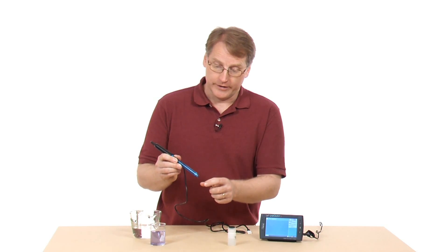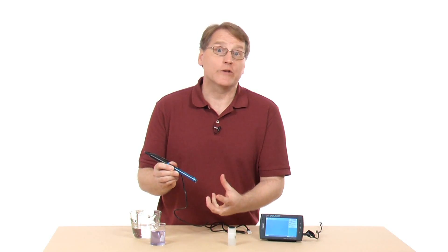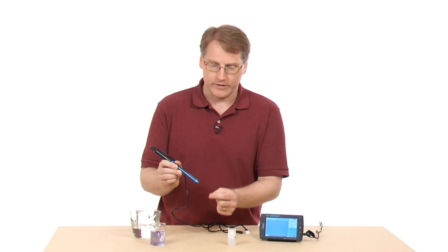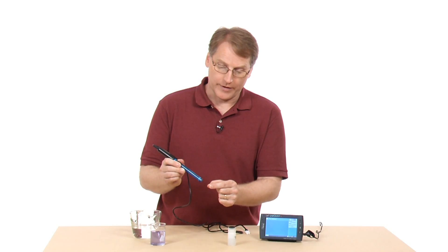But sometimes students will put this down. Maybe you're using this in a stream and they plunge it down and hit it on a rock and break it. That's why it has the cage, so you want to be a little bit careful with that.